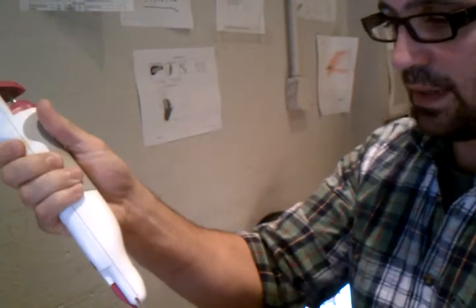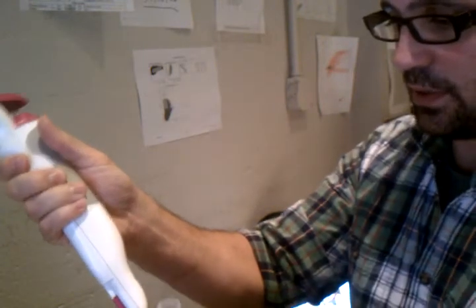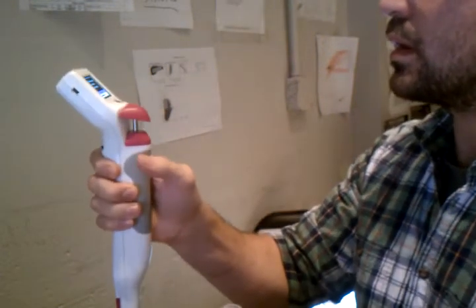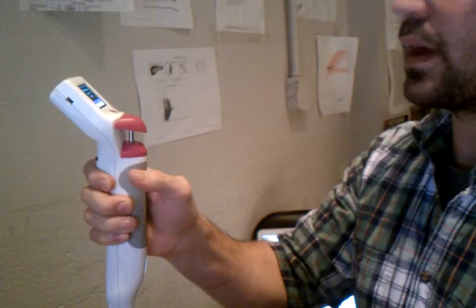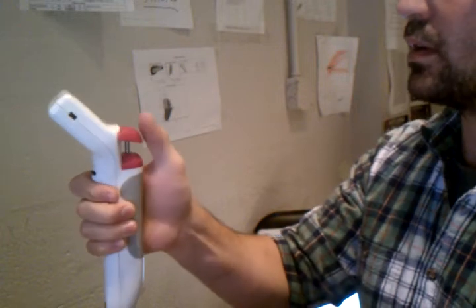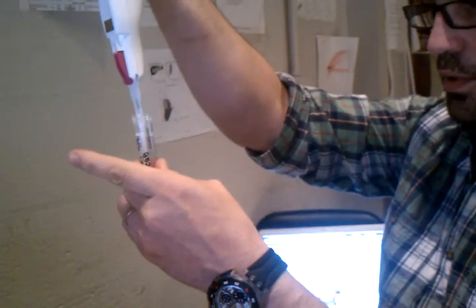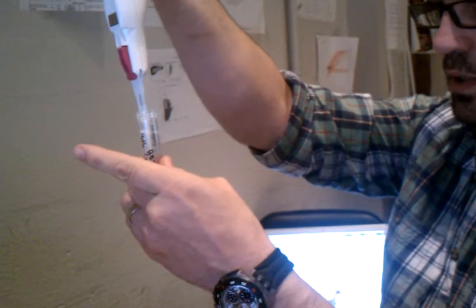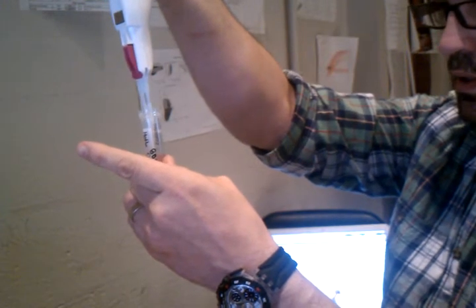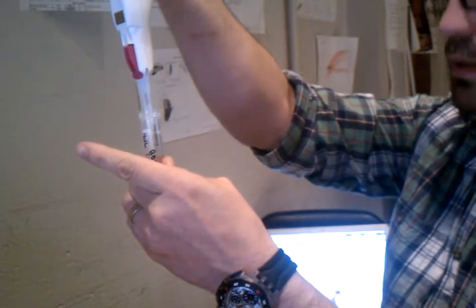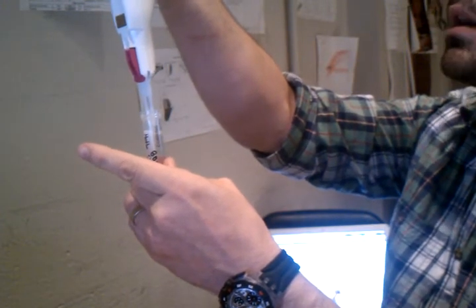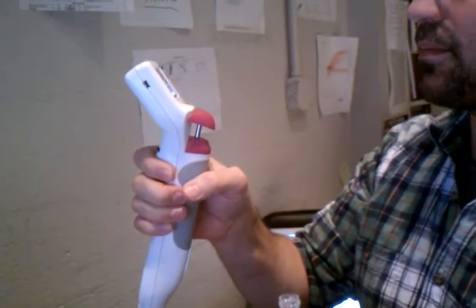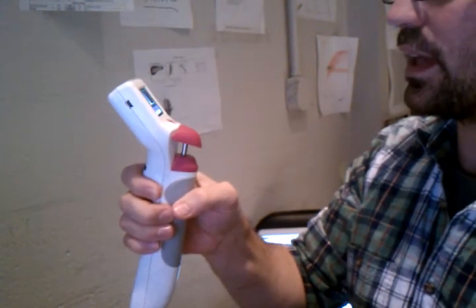So I'm going to attach the sensor, characterize, hold out the plunger, submerge. Sample is loaded, calculating.